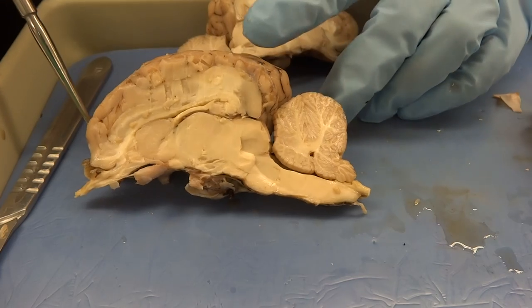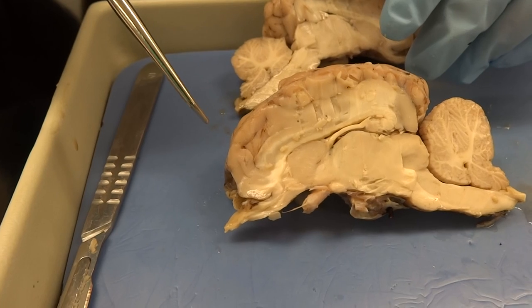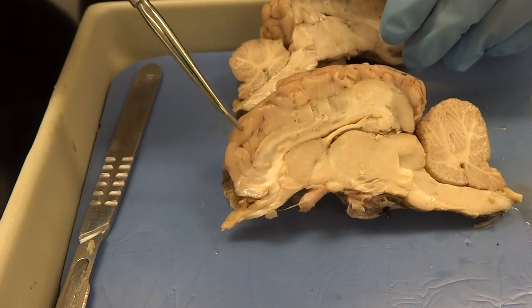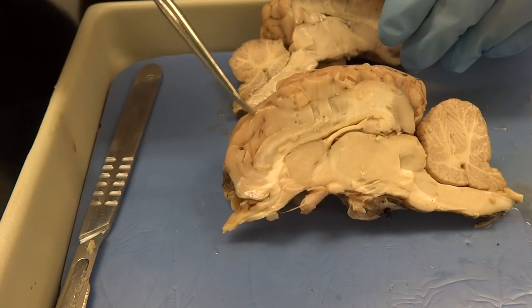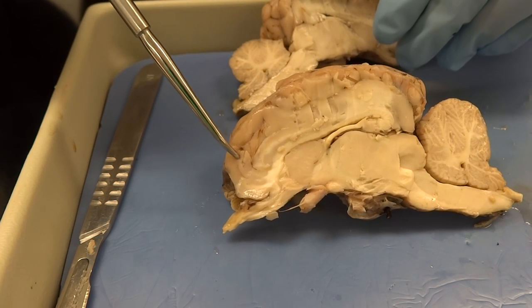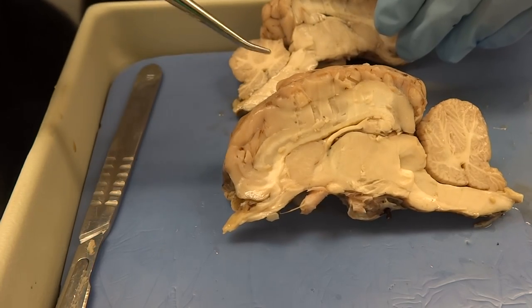Let's take a quick look at the gray and white matter. On the cerebrum, the gray matter and white matter are in the same relationship as on the cerebellum — the gray matter is superficial, which is the area we have more conscious control over, and the white matter is filled with all sorts of nerve tracts running through.